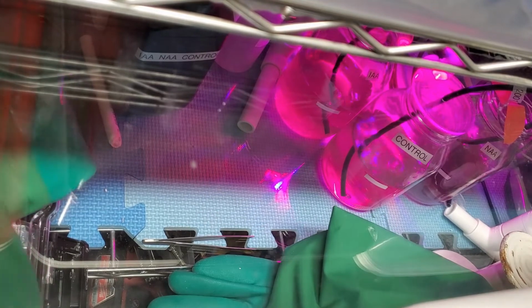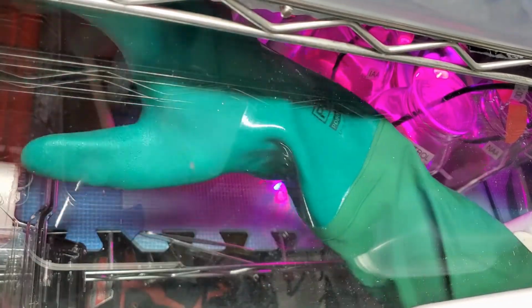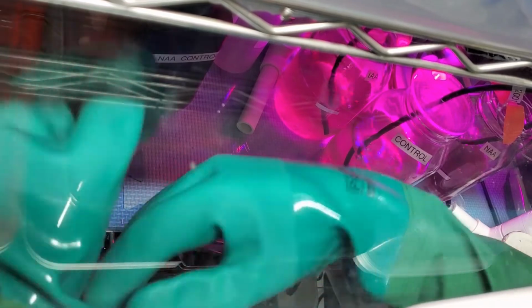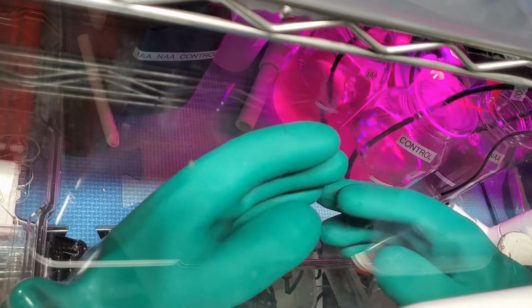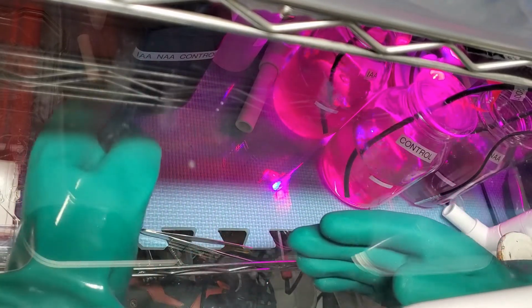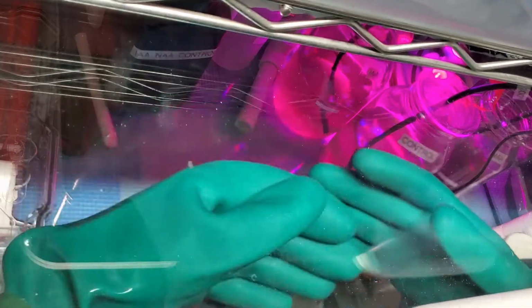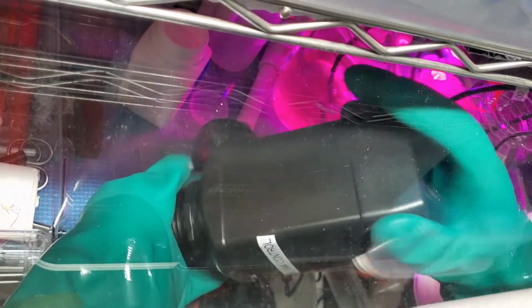Hello everyone, so now that I've gotten the boring moving the algae around stuff out of the way, now I'm going to actually add the hormones. And the way this experiment will work is I'll be adding it every 4 days, starting today, for 60 days, and then every 4 days I'll be taking measurements of the population of each container. And then I'll also be taking some pictures to see if there's any morphological changes, like essentially a change in the shape of the algae. Now I keep the hormones in this little case so the light doesn't interfere with it.